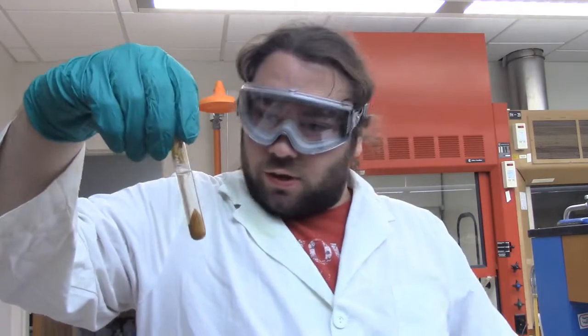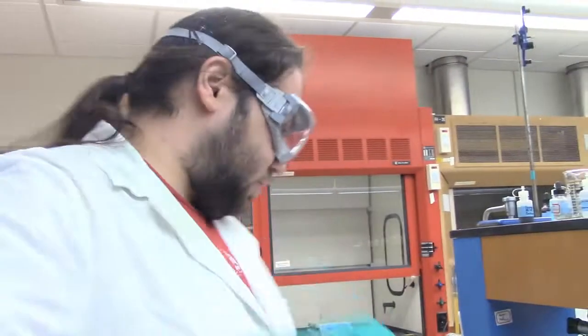Alright, so I've just finished centrifuging it, and we are left with a tan precipitate on the bottom and a colorless solution. So I think you figured out my catchphrase at this point. You guys tell me, do we have manganese in our solution?